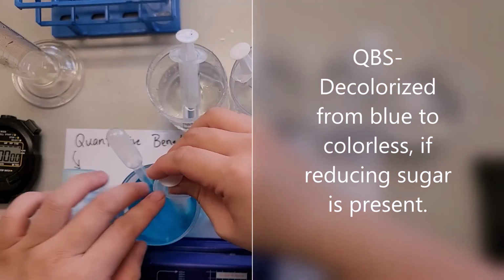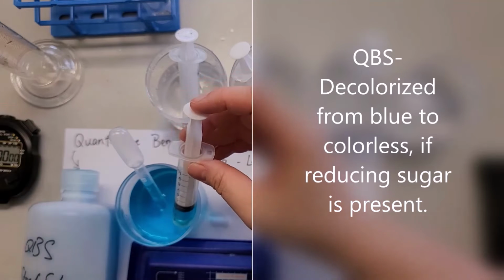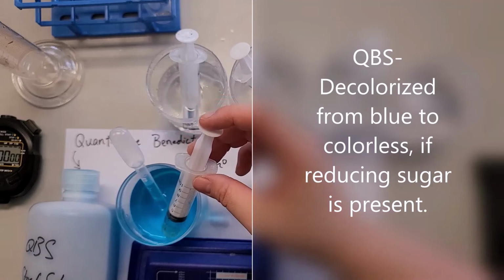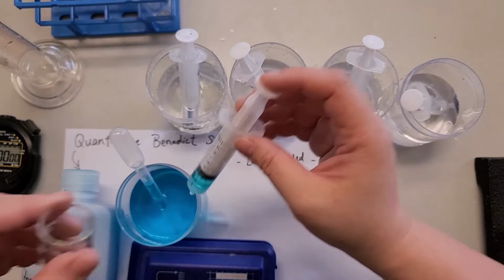Now, the good thing about the QBS is that if there's sugar in it, then it would decolorize. So it changes from blue to colorless if there's sugar present, within the same time frame.